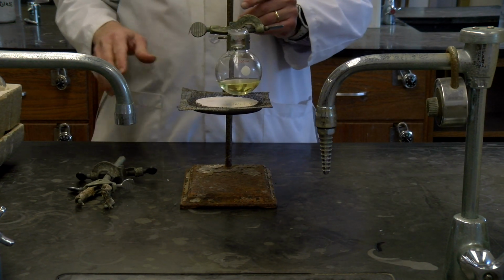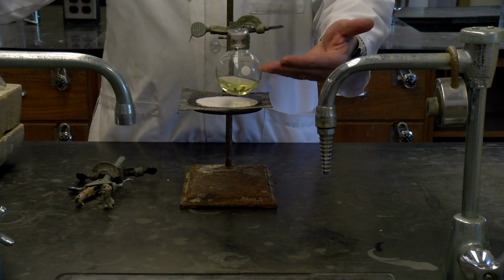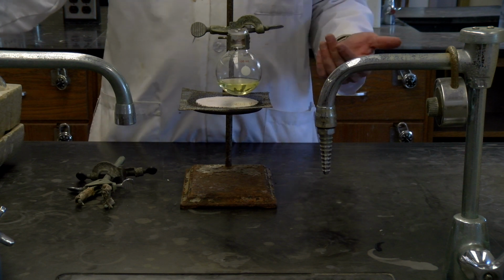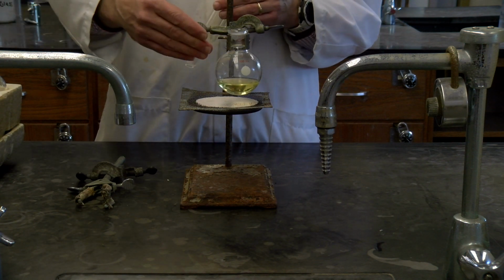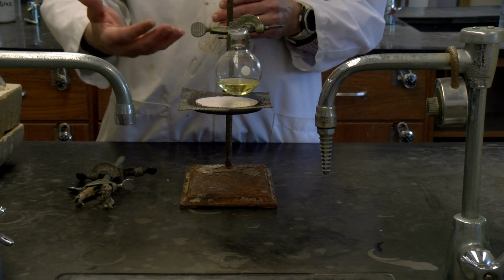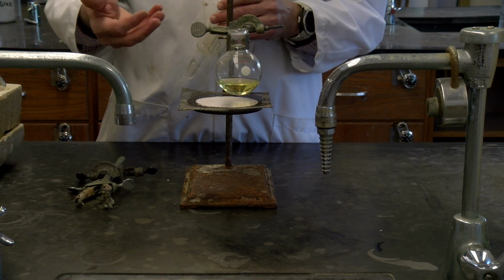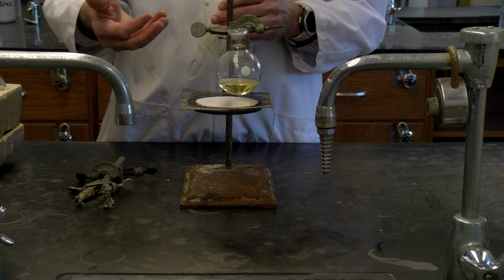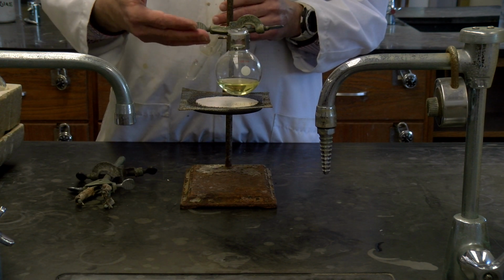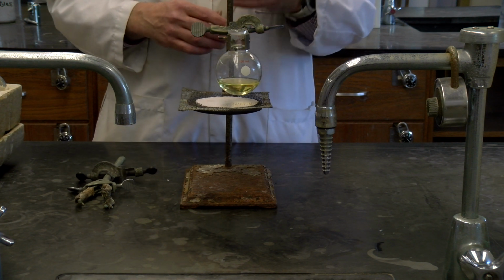Alright, so one of the things that we also want to do is a reflux, which is what we're going to do. We're going to heat this mother liquor up with the added HCl. The added HCl will help the maleic acid, which is in the cis conformation, help that double bond break temporarily, and form the lower energy, more stable trans conformation. And so the acids, we're going to heat that up, give some energy to let that happen.